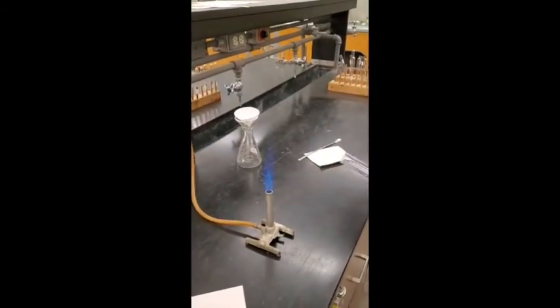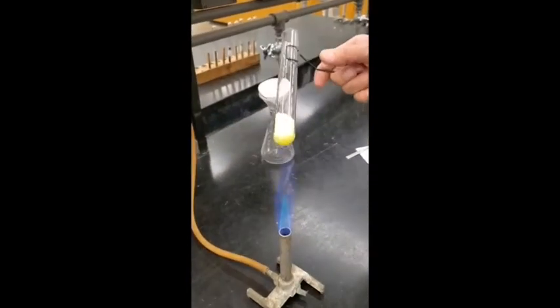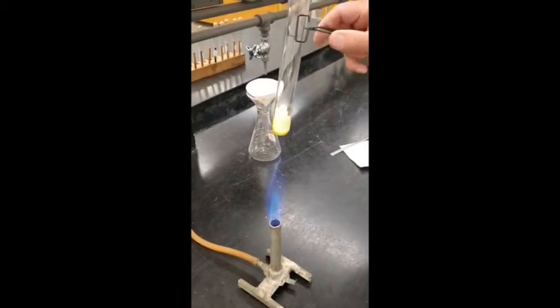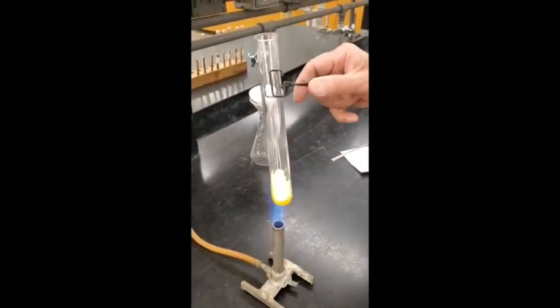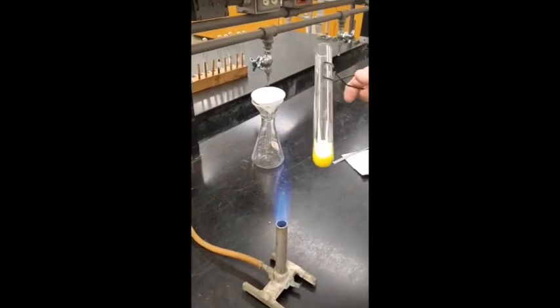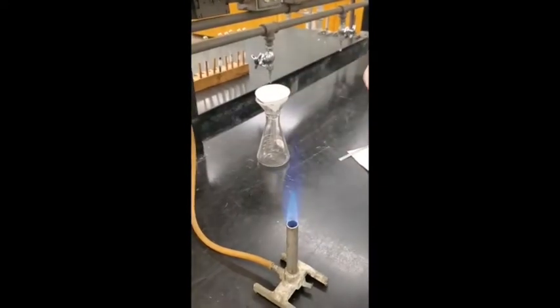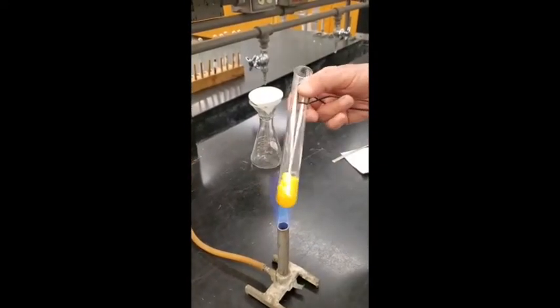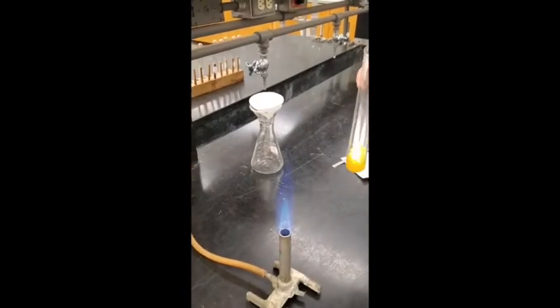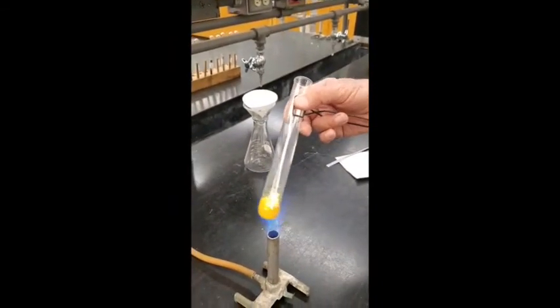Let me get my test tube holder here. I'm going to start melting it now. It's starting to melt — can you see it melting? It forms a liquid of the same color. I'm going to heat it gradually. See, it's starting to melt now. Once it gets all liquid, I'll pour it into the filter paper.